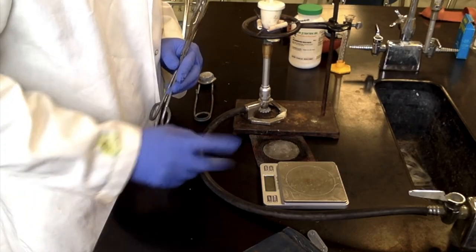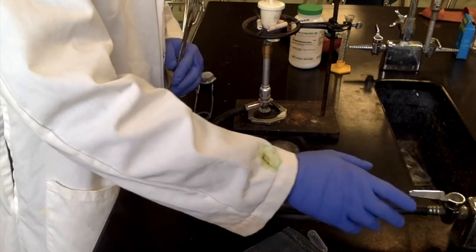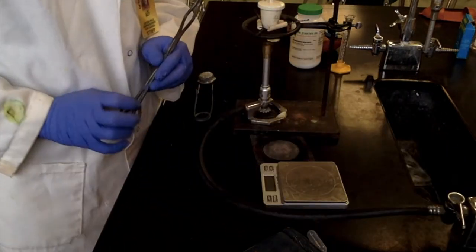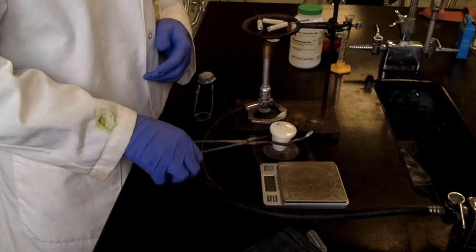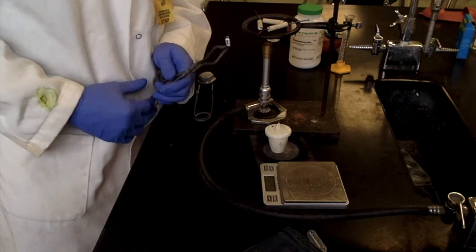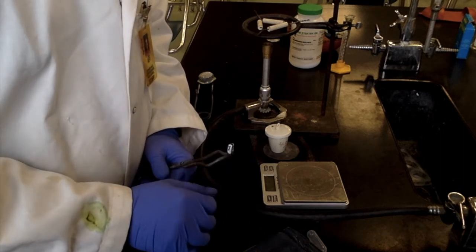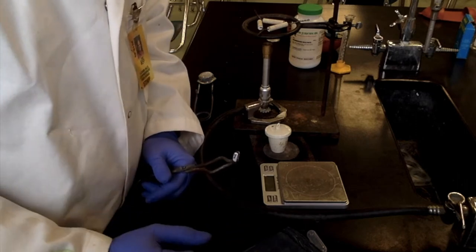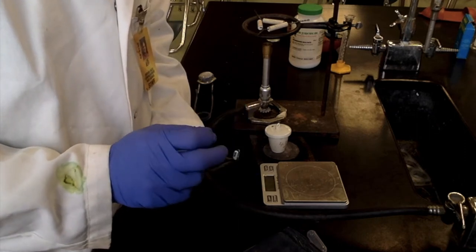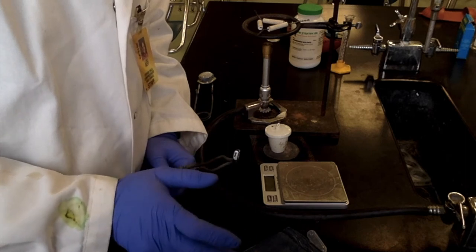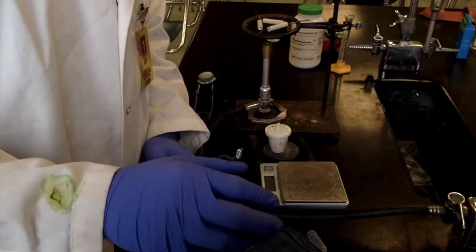All right. So it's been heating for the second heating for five minutes. So we're going to turn off the gas and then remove the crucible and cover from the clay triangle and ring stand onto our ceramic mat. And we'll be back in another five minutes to get a second mass measurement, and see after the second heating, if we're going to need a third heating, because we're looking for a difference of 0.01 to 0.02 grams. So if there's a bigger difference than 0.02 grams in either positive or negative direction, then we'll have to do a third heating. And then it should be essentially dry.